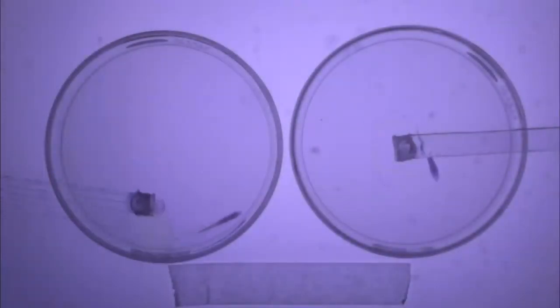Avoid making any noise or vibrations while positioning the vibrating glass rod in the water as fish can sense minor noises and vibrations. Make sure to finish this procedure within 30 seconds of starting the video recording to ensure that more than three minutes of behavior is recorded.